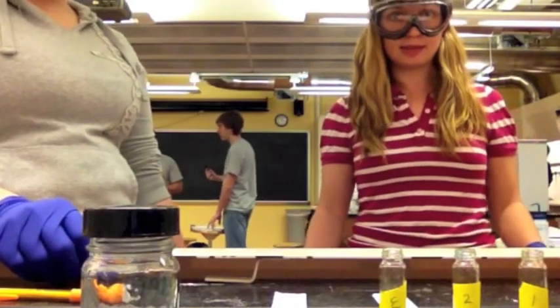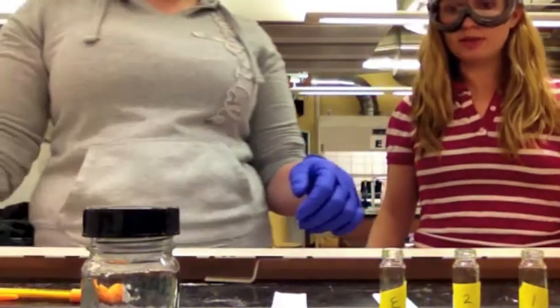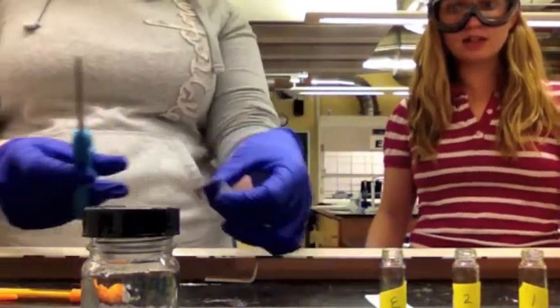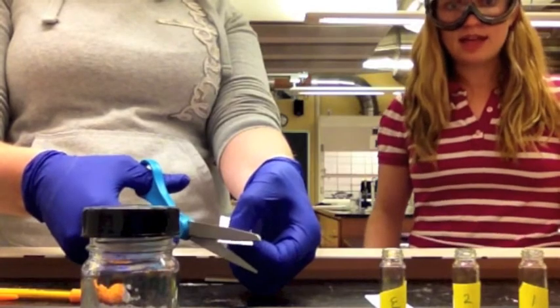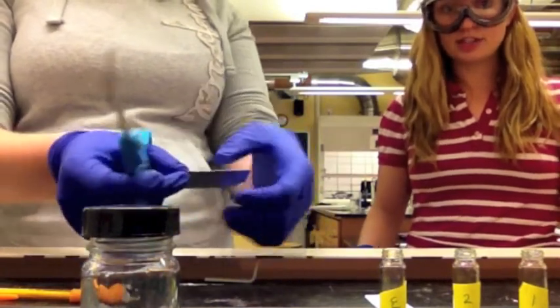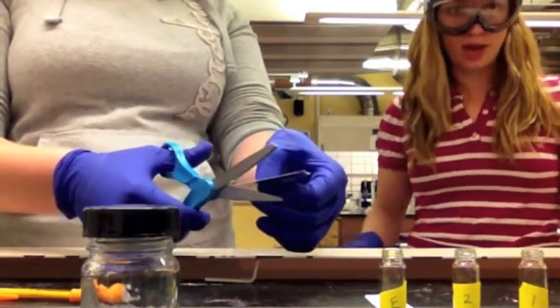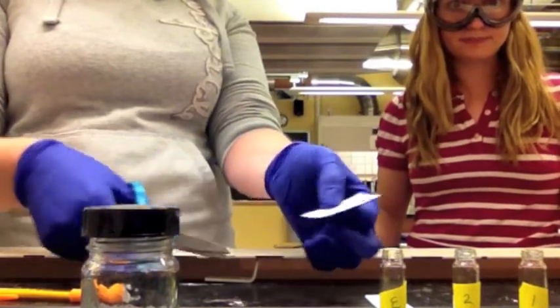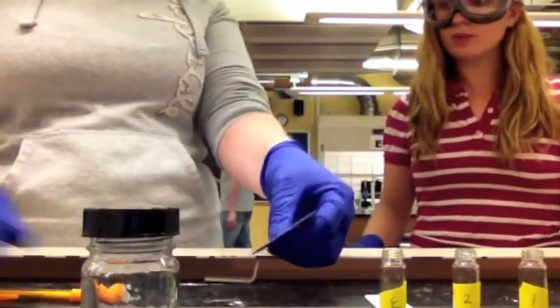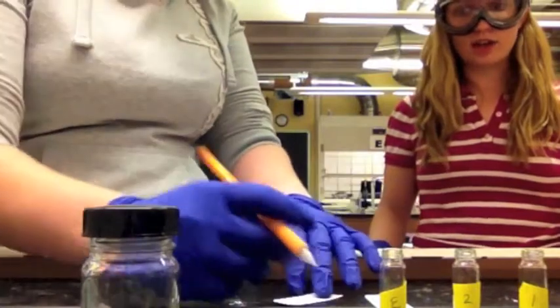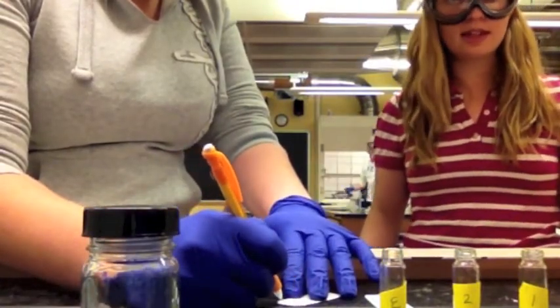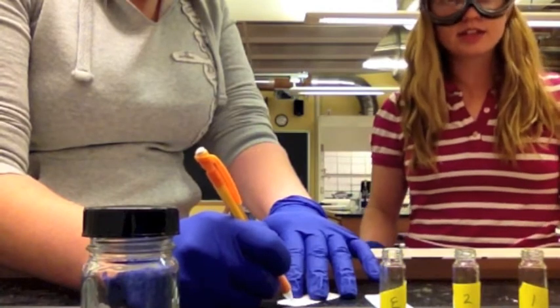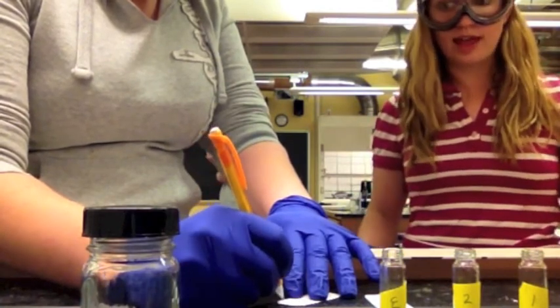We must prepare the silica plate. So in order to do this, we are first going to cut the corners of the silica plate off on one end. This allows capillary action to more quickly move up the plate with the development solvent. Then, we will carefully draw a line across the bottom with pencil. Pencil can break the silica, so be sure to lightly draw the line.